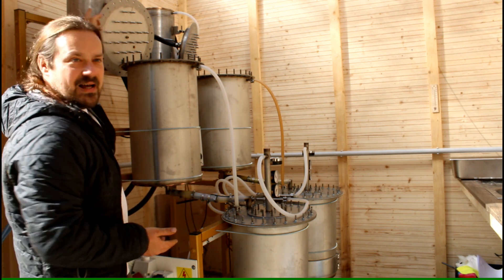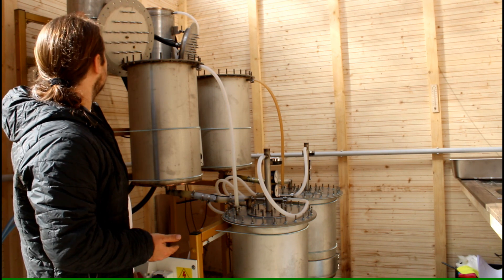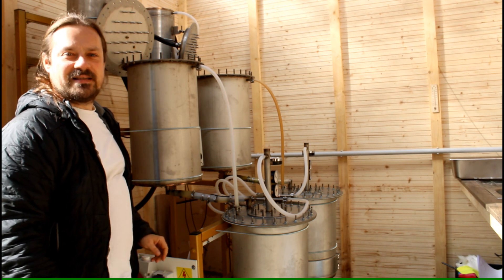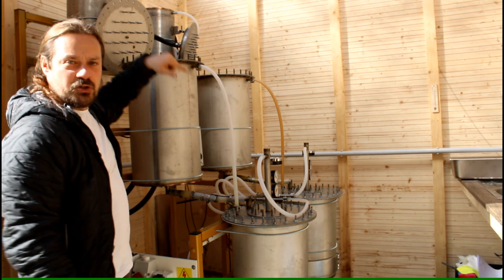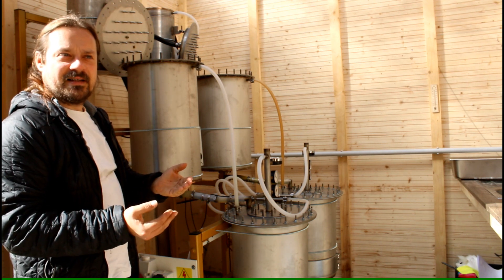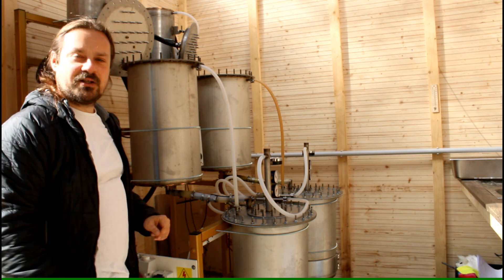And on the last etage there are the condensers, the actual condensers. So the vapor is condensing at the lids and also what does not condense at the lid will condense in the actual condenser.